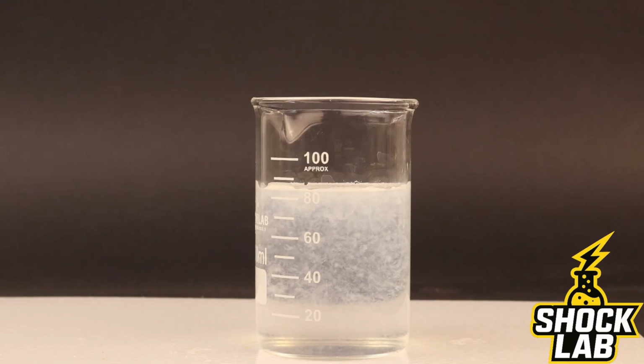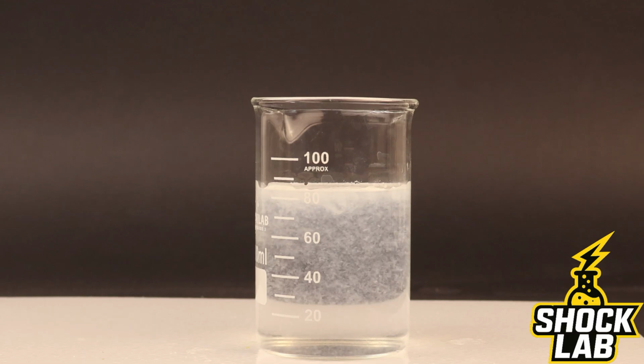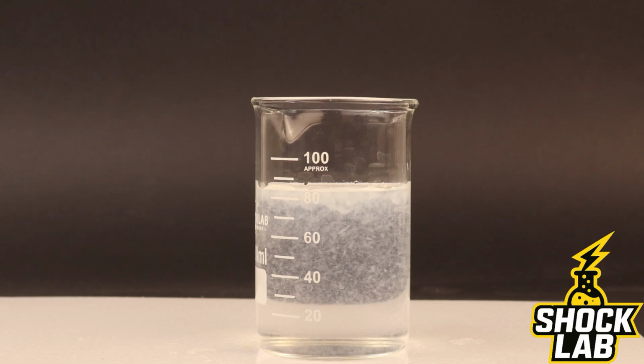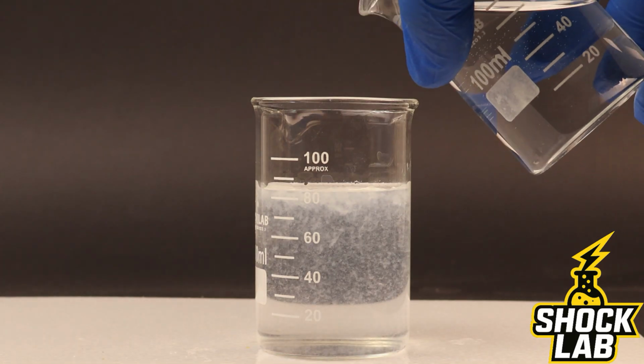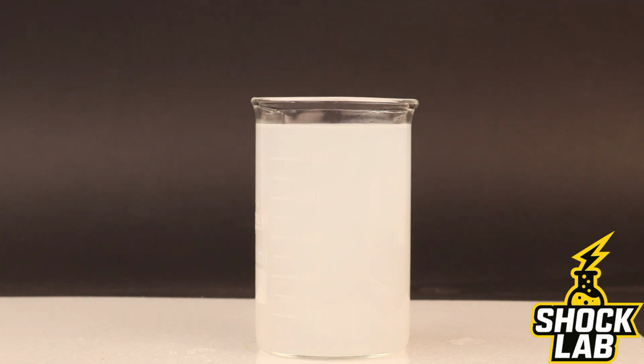As sodium hydroxide is added, the solution immediately starts to turn cloudy. Within seconds, a thick white precipitate appears throughout the beaker. This white solid is aluminum hydroxide, which forms when aluminum ions react with hydroxide ions. The reaction removes aluminum ions from the solution and creates an insoluble compound, giving the mixture its milky appearance.